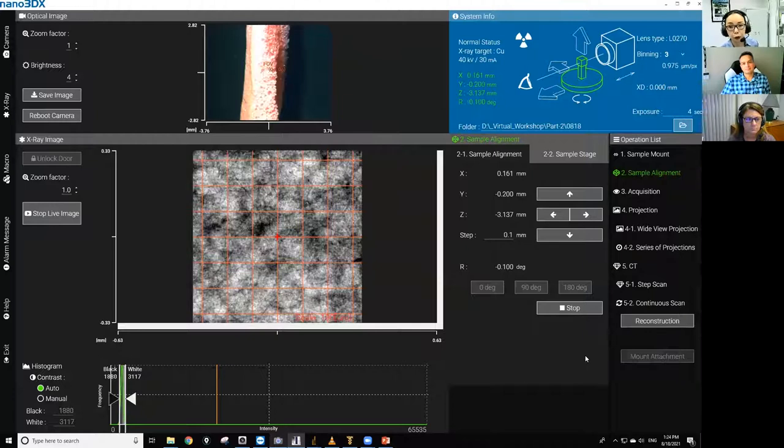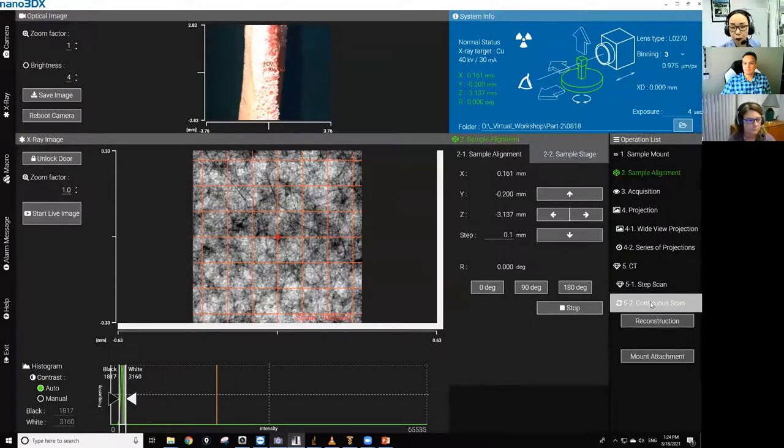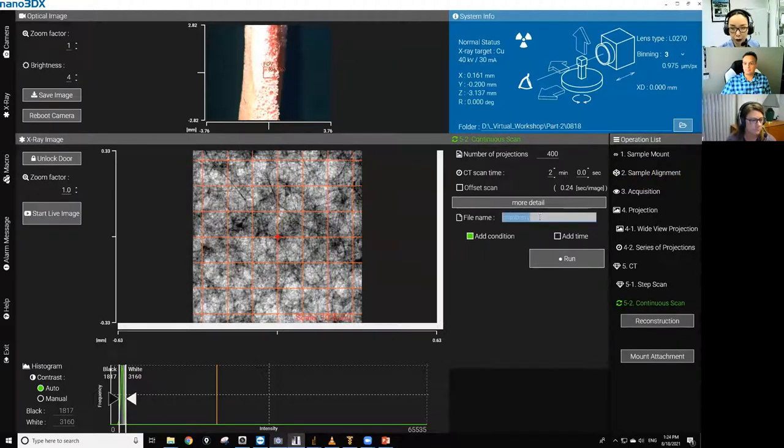And then we'll be doing a 2-minute scan for the rest of the workshop. And from the first exercise, we figured out that with this lens and a 2-minute scan time, binning 3x3 and 400 projections seem to be a good combination. So we're going to stick with it. And let me put a name for this file and start a scan.